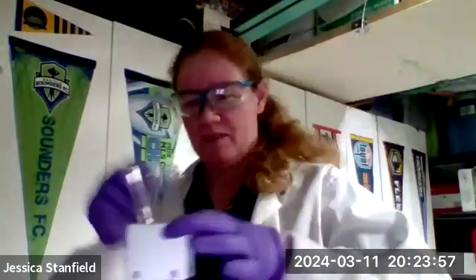All right, in this test tube right here, I've put a piece of marble, some calcium carbonate. Now I'm going to take some hydrochloric acid, and I am going to react this marble and this hydrochloric acid.